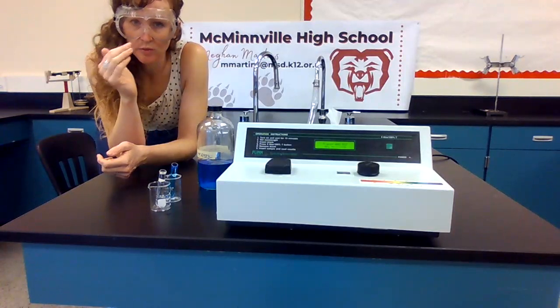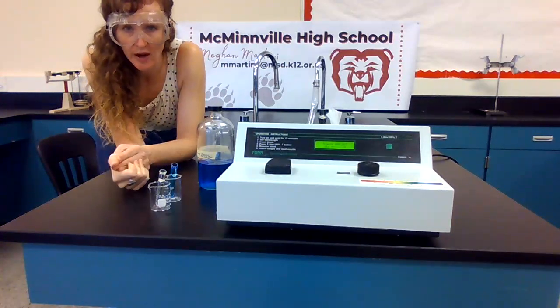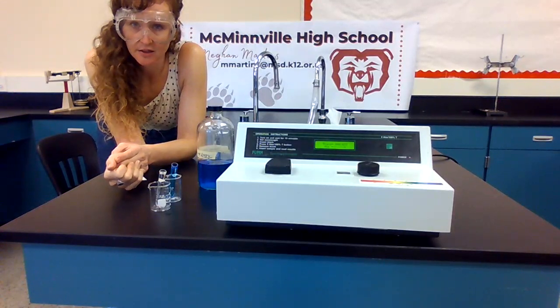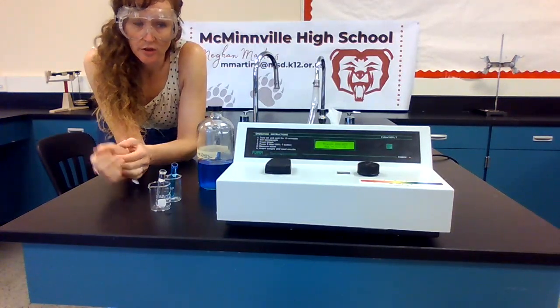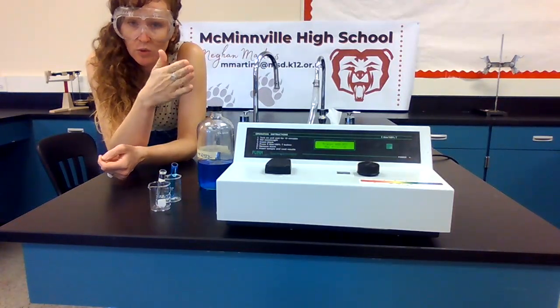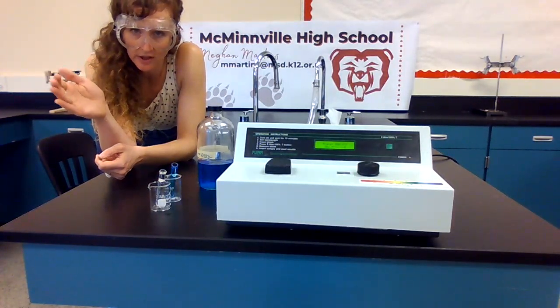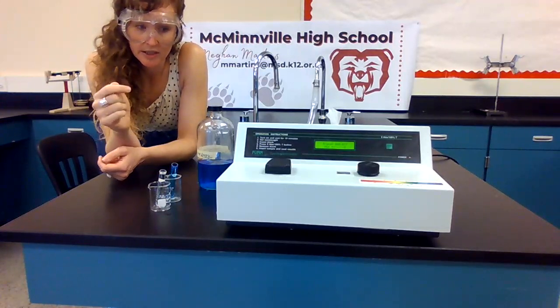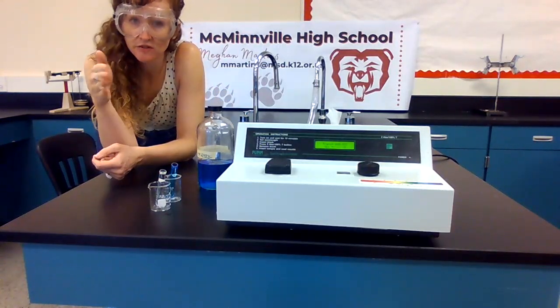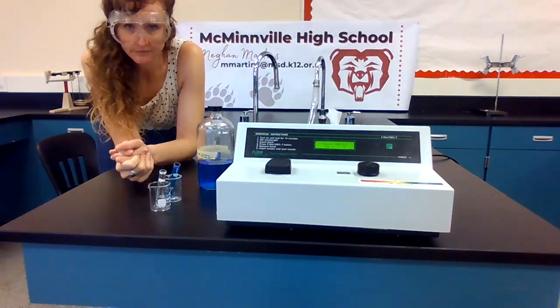And we are going to take absorbance at a bunch of different wavelengths. We're going to start at 400. We'll go every 20 nanometers all the way up to 700. So you are going to have to write down this data in your notebook. Again, your independent variable that we are changing is going to be wavelength starting at 400, and it'll increase every 20 nanometers up to 700. Your dependent variable is going to be the absorbance of light at each of these wavelengths as it travels through your copper 2 nitrate.